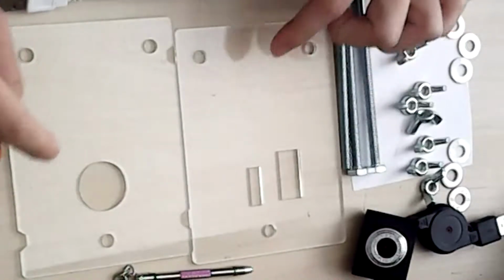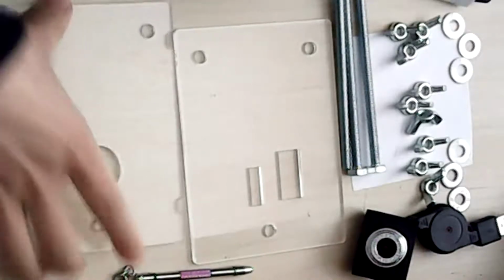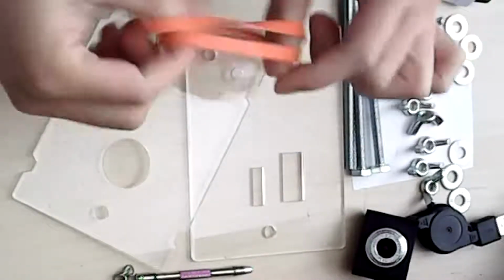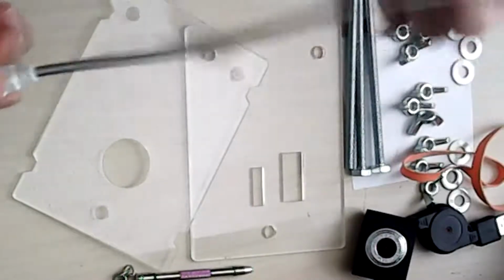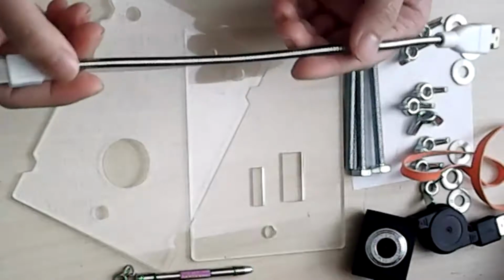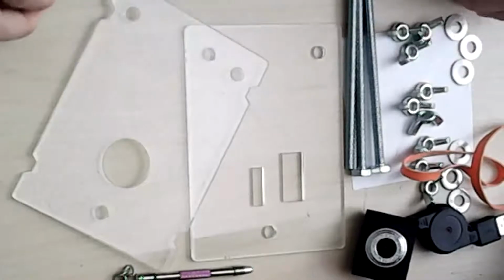They might be different materials depending on what version of the microscope you end up getting, but essentially these are just plastic. These are kind of hard to see on the camera. So you'll have 2 rubber bands, and you'll see what they are for, and then 1 light. It comes with this long gooseneck light, but anything with 1 singular LED works. I've used my phone flashlight, and that's worked. You can be creative with your light.